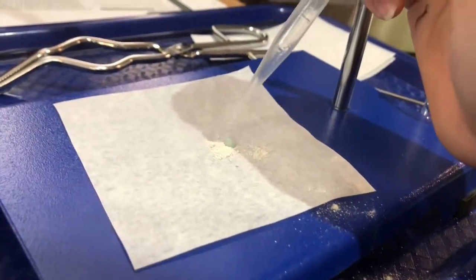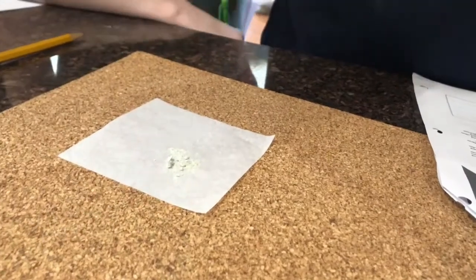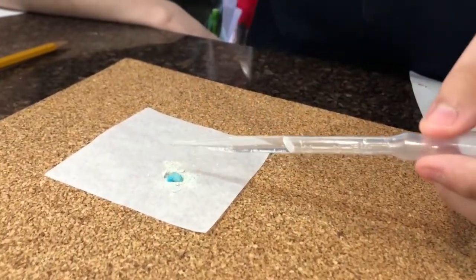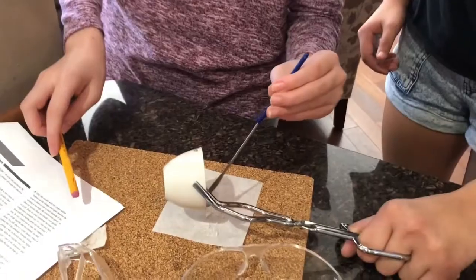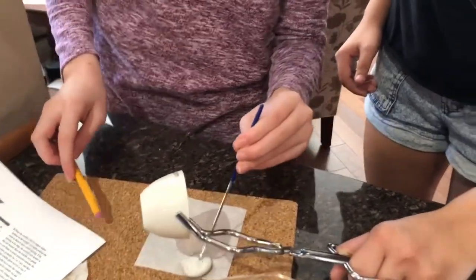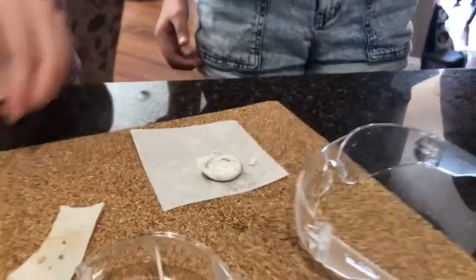Whoa! Nice. There you go. That's fine. Here's your water. Got it? Yes, ma'am.